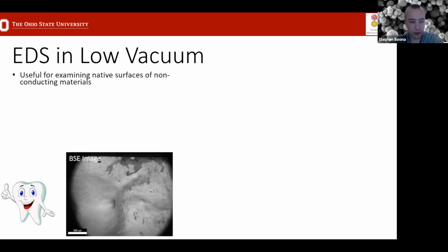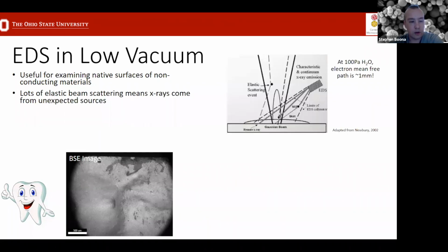So to go through an example here, this is the bite surface of a human tooth, a backscattered image collected under low vacuum conditions. In this case, we didn't want to have to coat the material with anything to alter the native surface. So doing this analysis under low vacuum, there's a paper from Dale Newbury at NIST. The people there, obviously this is what they do. They have a lot of really good research into how to do your analysis with better accuracy. So if you're looking for resources, Dale Newbury and Nick Ritchie at NIST have published extensively on a lot of these topics. I would highly recommend just looking for whatever they've published and digging through that.